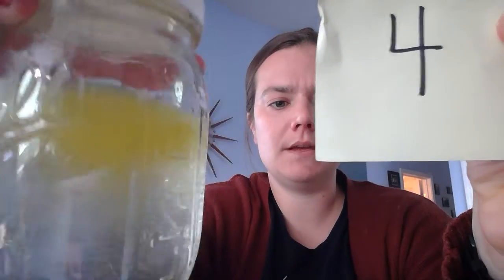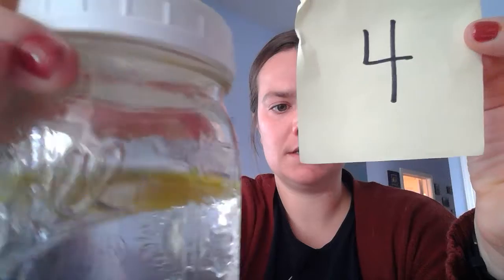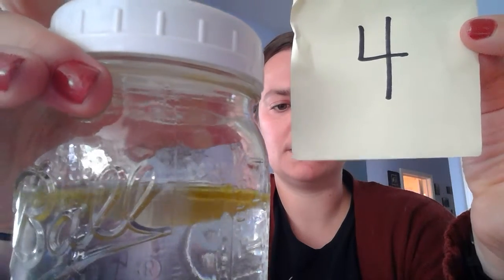Here is sample number 4. I'm going to mix it up. I can see through this substance, but if you pay attention, you'll notice there are some bubbles, but also some discoloration. It is pretty much all up at the top, and it appears there's almost a layer of whatever this substance is forming at the top. Okay, so this is number 4. Smelling it, it smells like an oil, some sort of oil that you've used for cooking.